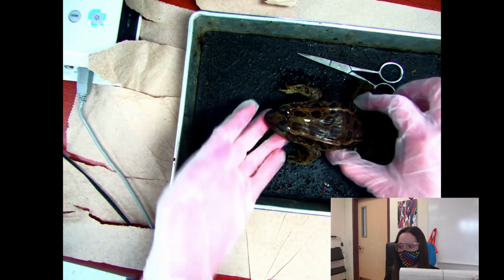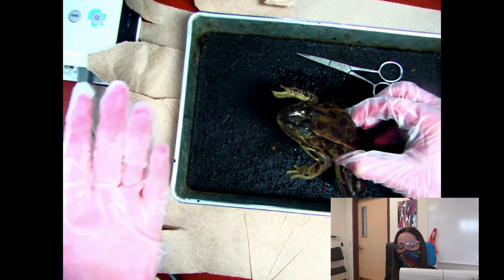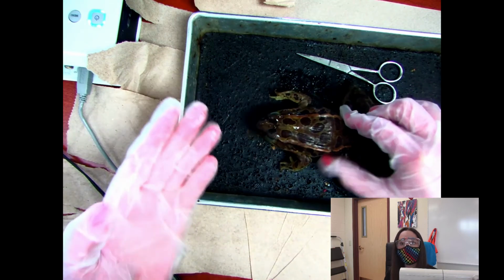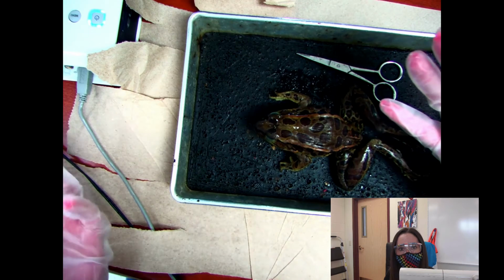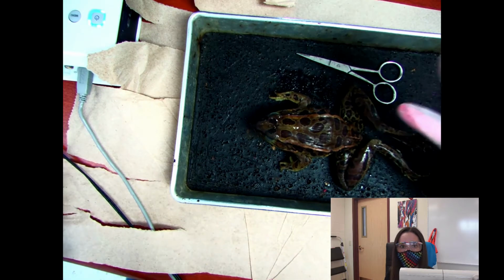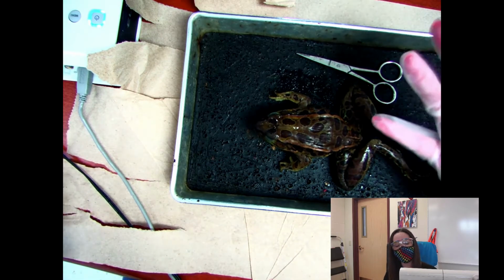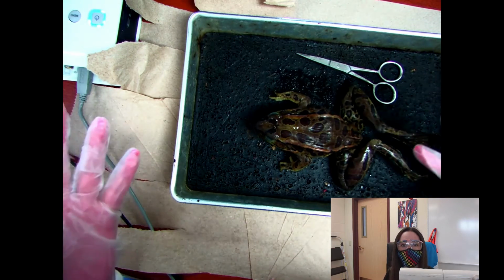This is the frog that we're going to use, and I feel like this video is really going to help students that are remote, but also students that are in class. We are going to have a quiz on Wednesday/Thursday, depending on when you're in our class. So this video is both for my students and Mr. Tricky's students because we are doing the same exact thing. We're going to start with the external features first. So let's go ahead and get into that.